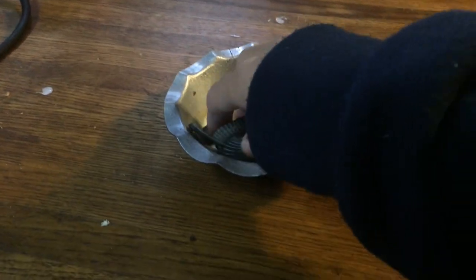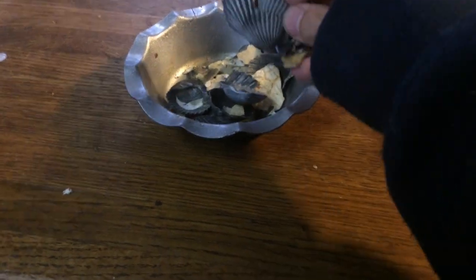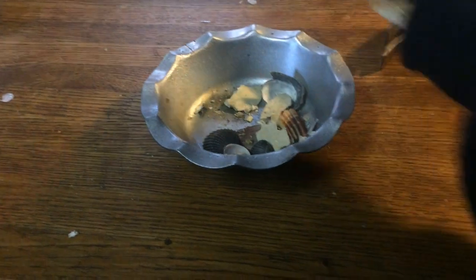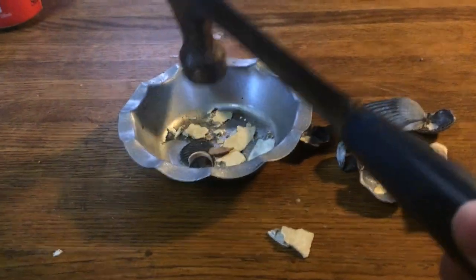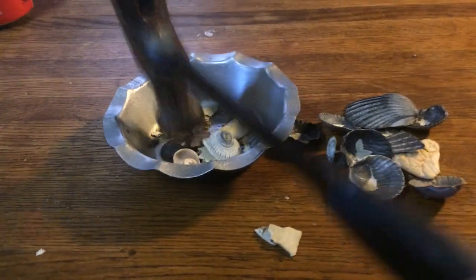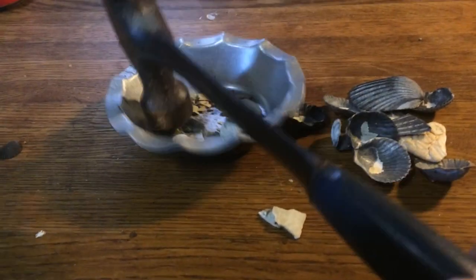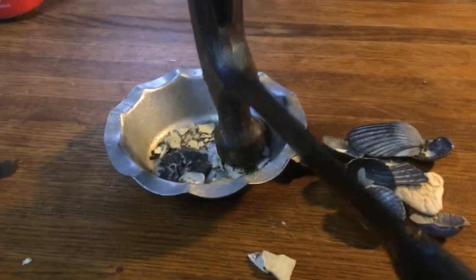As a source of calcium carbonate, I have all these shells, which I'm gonna crush up in this makeshift mortar and pestle here, because I was too lazy to get my actual one in the kitchen. I'm gonna make this nice and fine so that it will react faster with the hydrochloric acid.